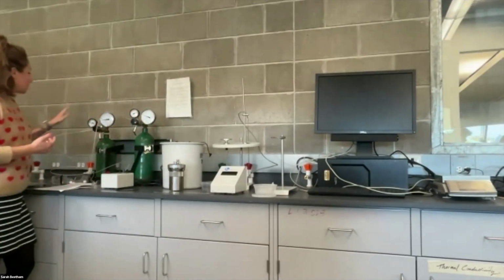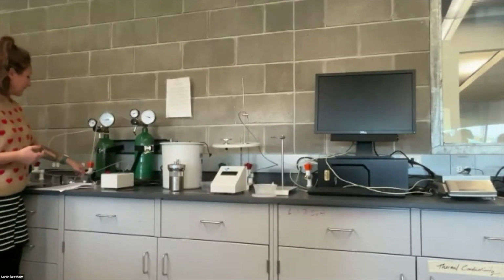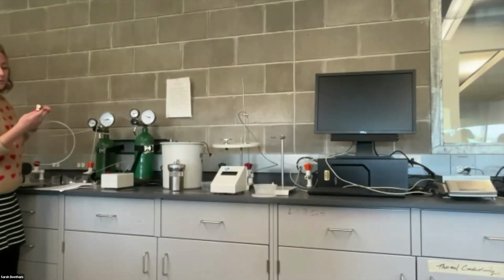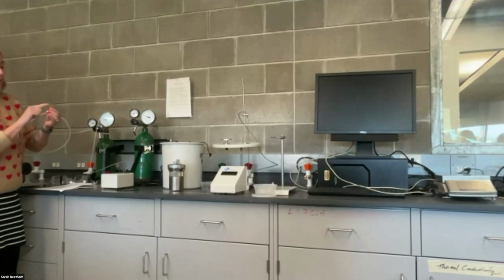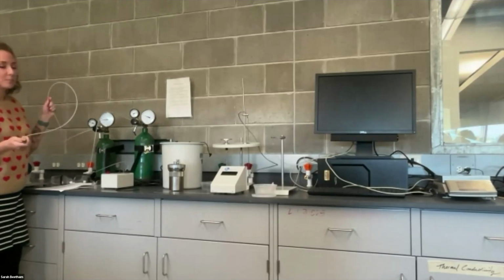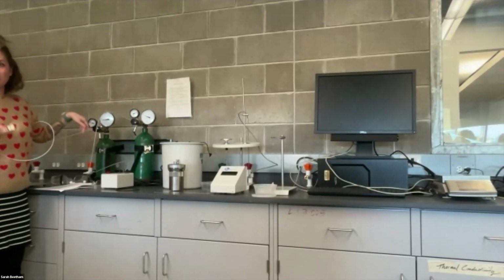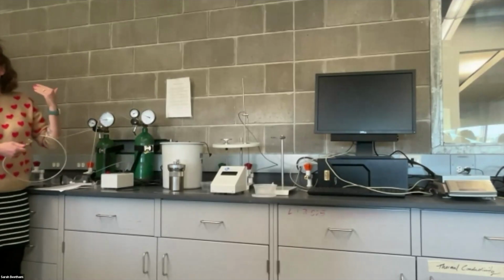All right, and so we're gonna do that using either one of these oxygen tanks. And at the end of the hose line is this fitting. It'll be kind of hard to see from there. You can come take a look afterwards if you'd like, but there's a little black O-ring inside of here. If you don't follow all the steps to release the pressure in this line after you've filled the bomb and you try to pull this off, the O-ring's gonna go flying.